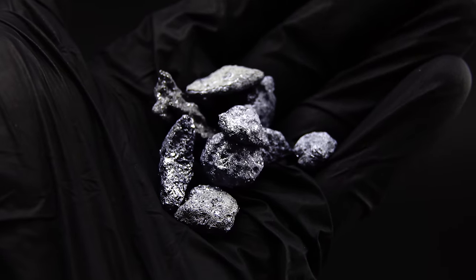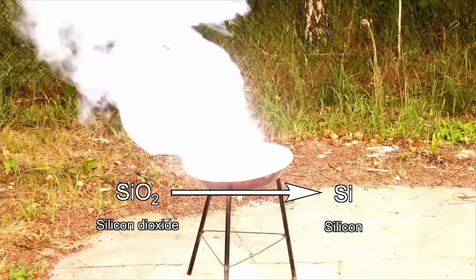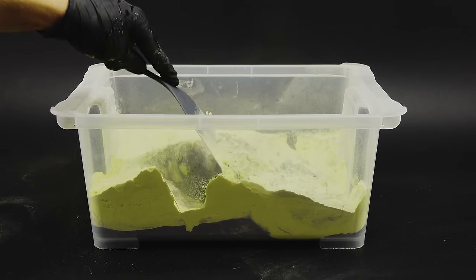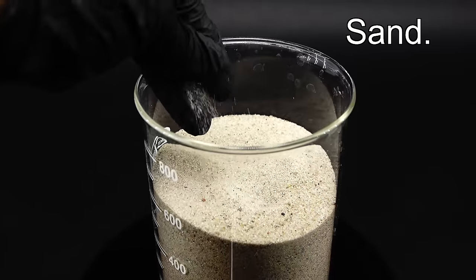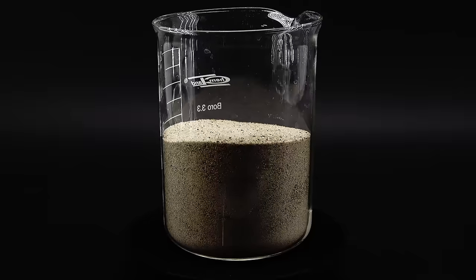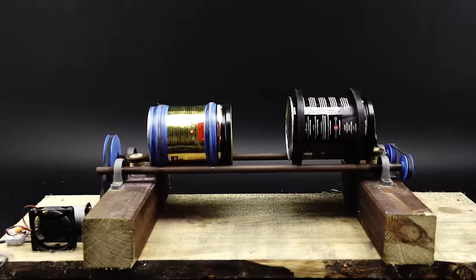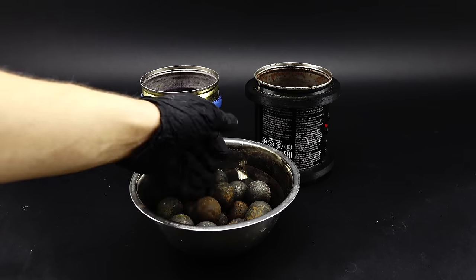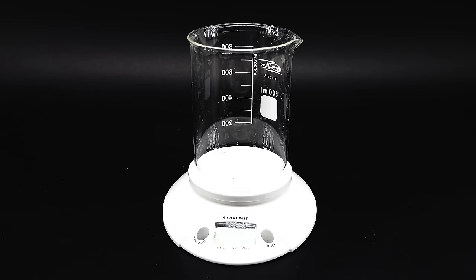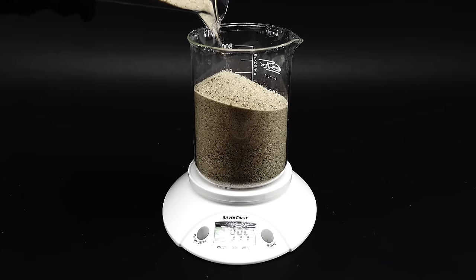With the sand now ready, I can start making the silicon. I will do that through a modified thermite reaction, which while producing enough heat to greatly contribute to global warming, rips the oxygen atoms off the silicon dioxide, turning it into elemental silicon. The efficiency of this process greatly depends on how finely powdered its ingredients are, and since my sand is well, sand, I have to pulverize it. To make it into a fine powder, I could use something like a mortar, but that would take forever, so exactly like in my last video, I turned to the only feasible option, which is my good old DIY ball mill. To start it up, I first had to measure out how much sand I wanted to grind. There was no way I would be processing the whole 5 kilos, so I settled on 1 kilogram instead, which is still orders of magnitude more than the last time.